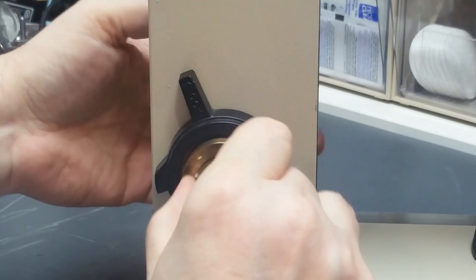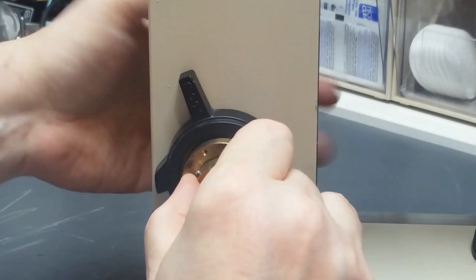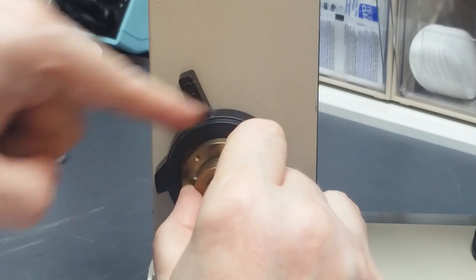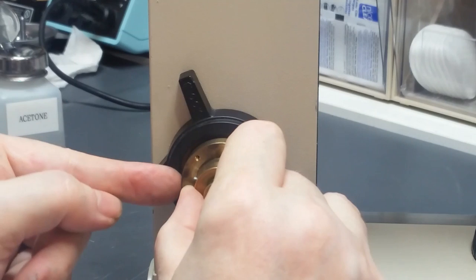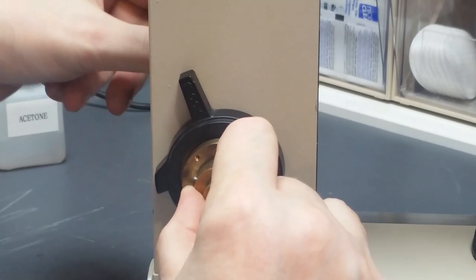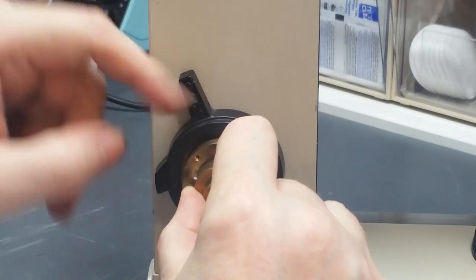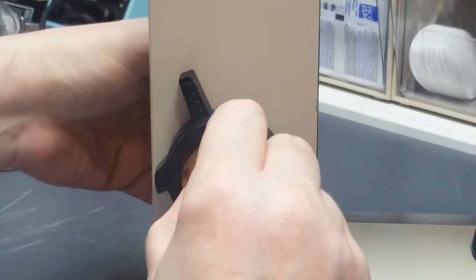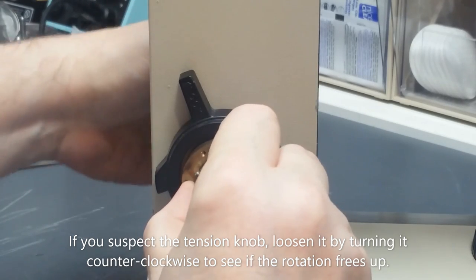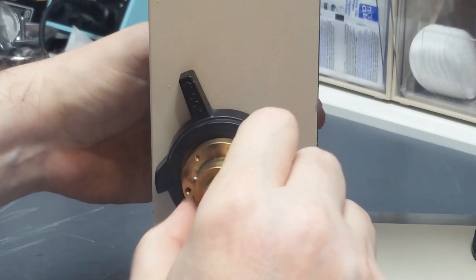While I'm doing that, I want to periodically make sure that this thing still moves and is not tight. If I get to the point where it quits moving and is really tight, then one of two things has happened. Either that spring has gotten out of place and has been pinched in there, which is a bad thing, you don't want to do that. Or potentially the focus tension knob is adjusted improperly and it's causing tension. So I'll just keep going, making sure it's still loose. Okay, now it's bottomed out and it's still reasonably loose, so I think we got it good.